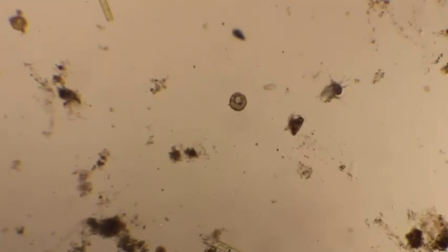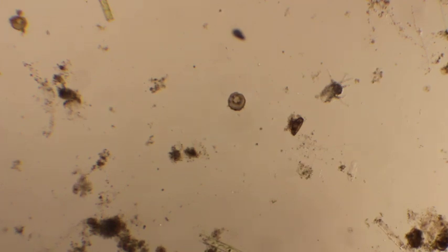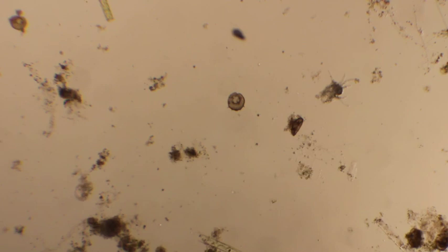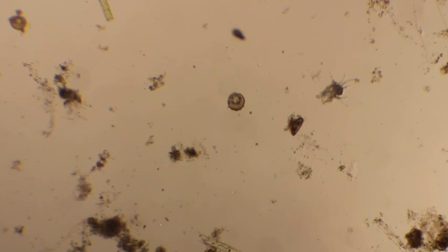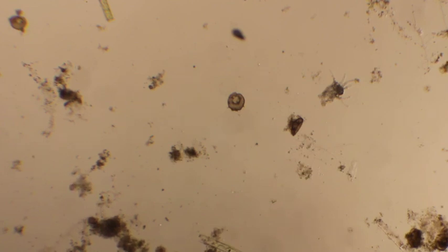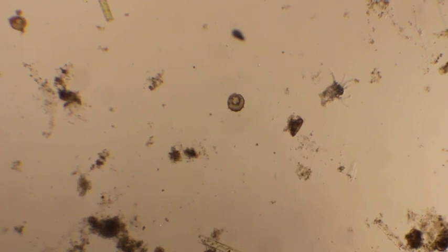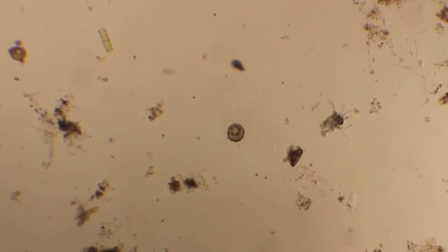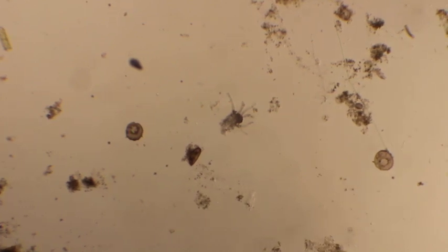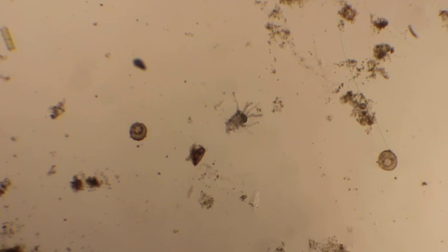This is our amoeba slide. We're right now under the 4x objective, so it's magnified 40 times. Amoebas are interesting — they're single-celled organisms, and actually quite large single-celled organisms, and they're very slow-moving. The key to finding an amoeba is knowing what you're looking for. In here there are actually two different types of amoebas on this particular screen. I'm gently going to move into the very center of the amoeba, and I know it's an amoeba mainly because I know what I'm looking for.